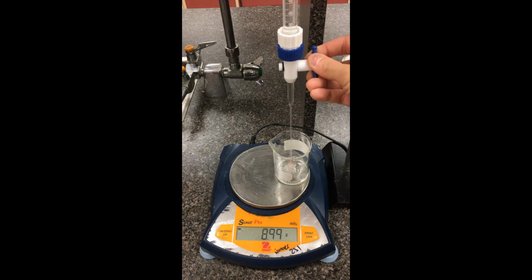Going down to 12. That one, I'd say 12.04. Again, you can just record down that mass there. Go down to the 15 mark. A little bit more. Okay, so that would be 15.10. You can record down that mass there. I'm just doing increments of 3 for simplicity. It doesn't need to be exact, so I did a little bit too much here, so that's going to be 18.20. So that has that mass there.